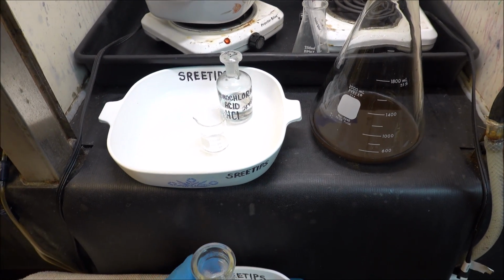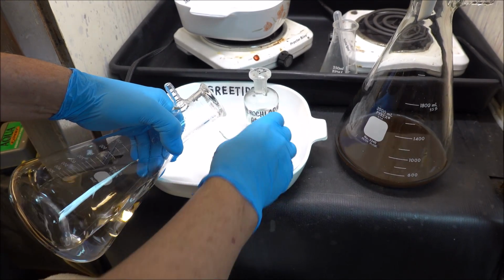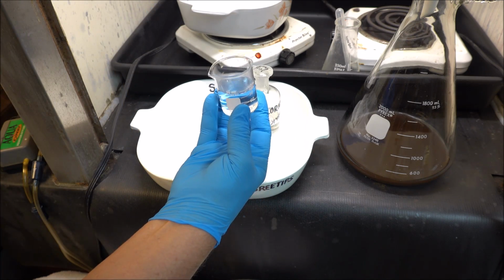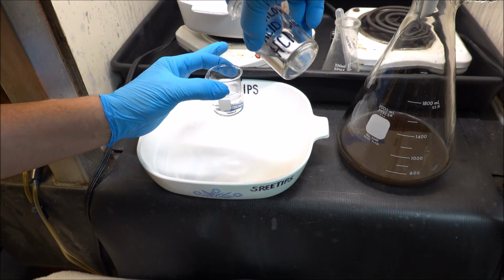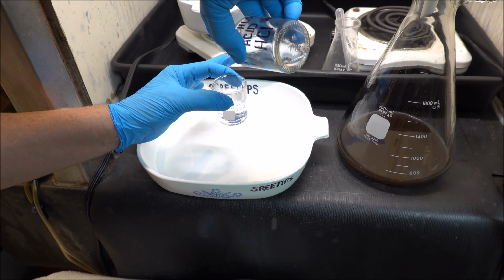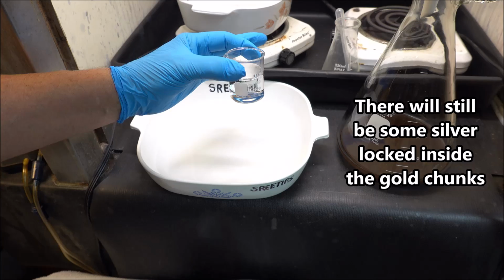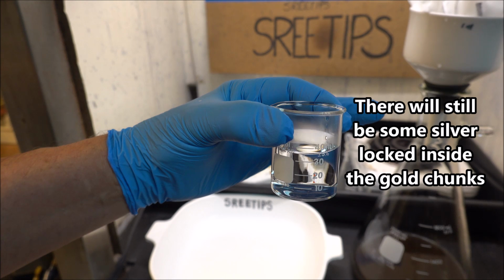Take a little bit of this water down here, and I'm going to add a little bit of it to this beaker. And what we're going to do is do a test on this rinse water that came off the gold with hydrochloric acid, and see if we get silver chloride forming in this rinse water. I don't see anything. I think we're going to be good to go here. I don't see any silver chloride forming in there.